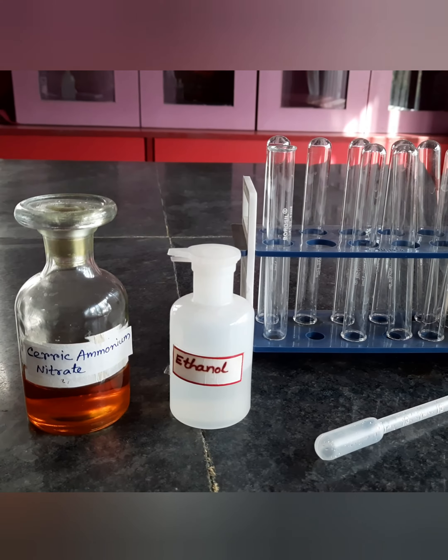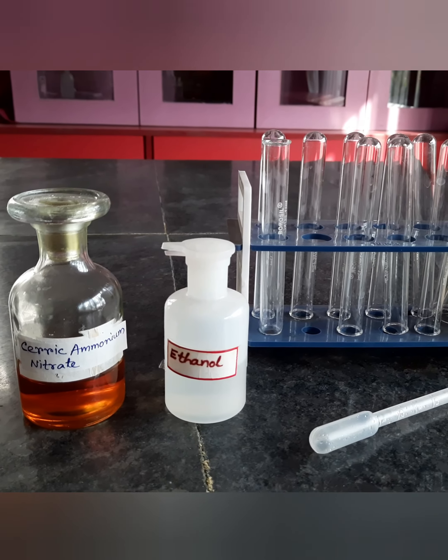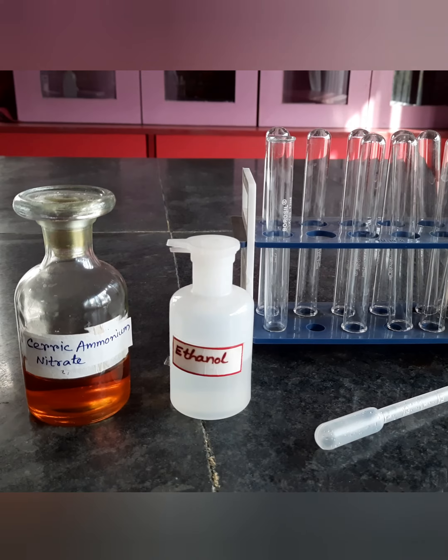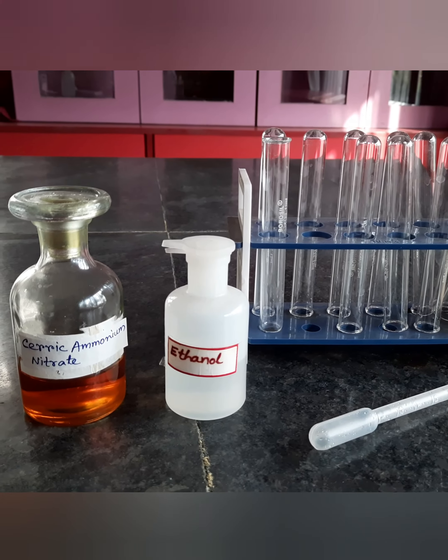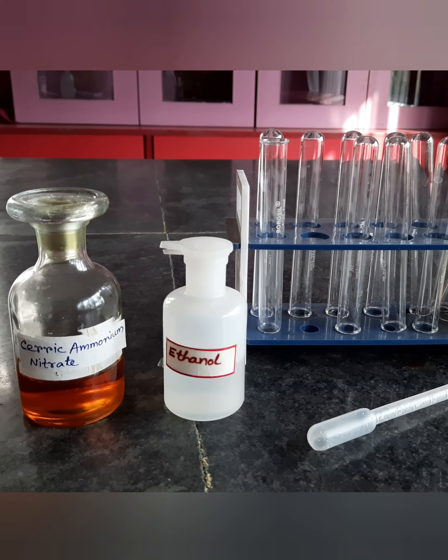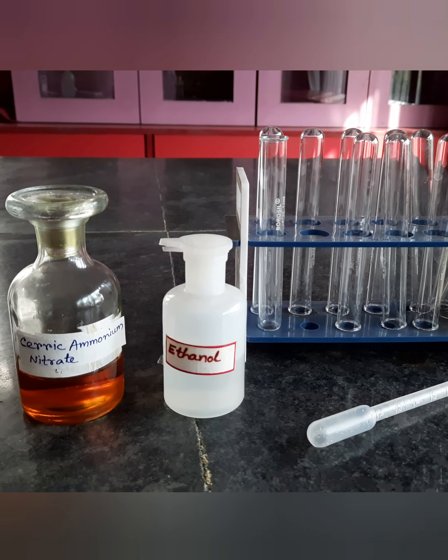Ceric ammonium nitrate test is one of the very common and easiest methods to identify the presence of an alcoholic functional group in a given organic compound.